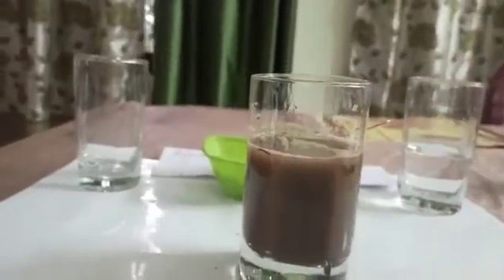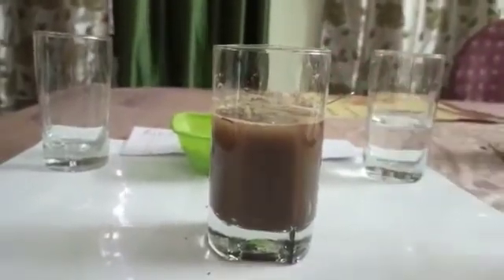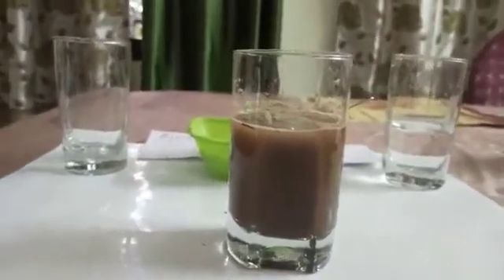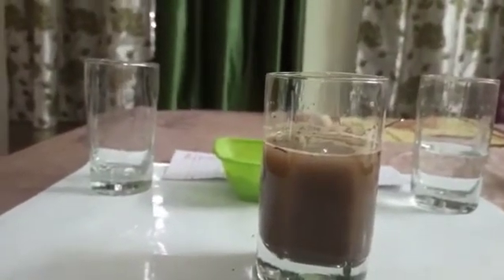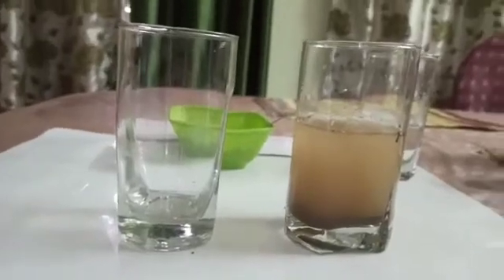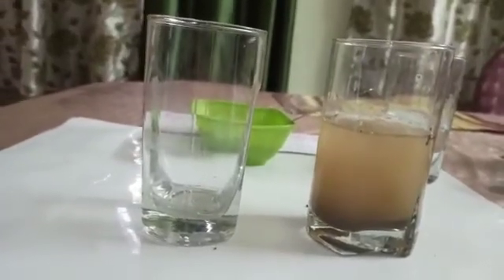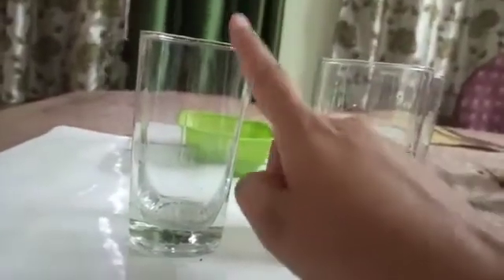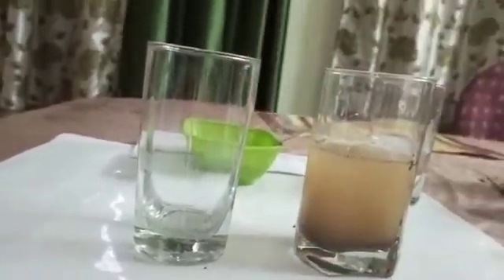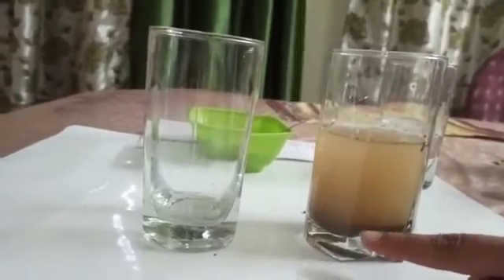Now leave the mixture to stand undisturbed for some time. The sand particles will settle down at the bottom of the glass. Then slowly decant the clear water into another glass without disturbing the layer of sedimented sand.